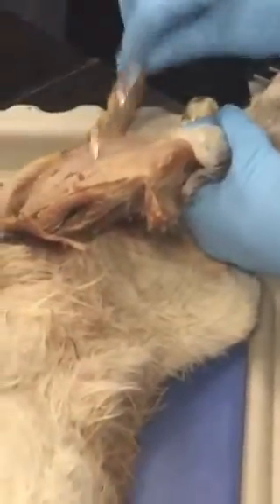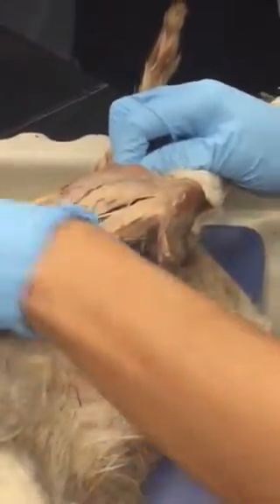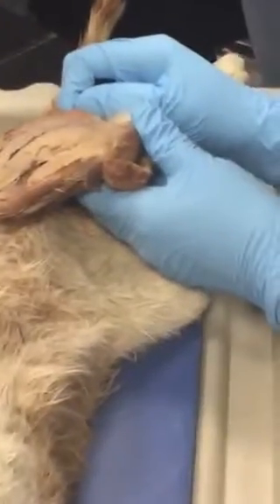You see this muscle. Sometimes I joke that this is like a course in journalism. So many future stars for CNN. Oh my God.